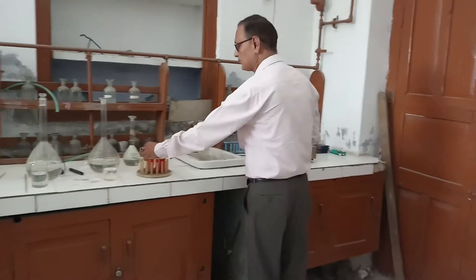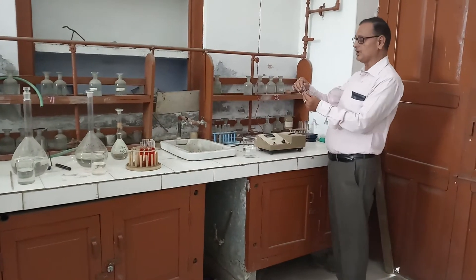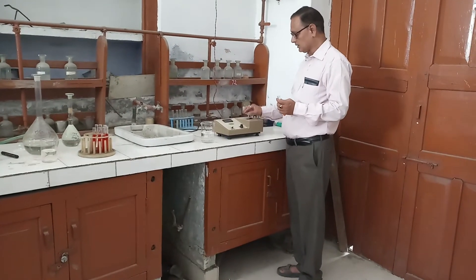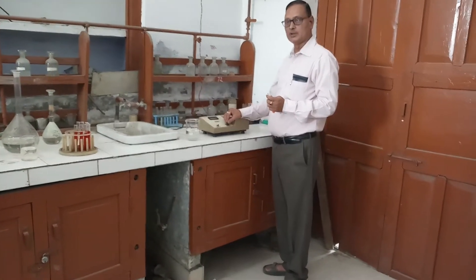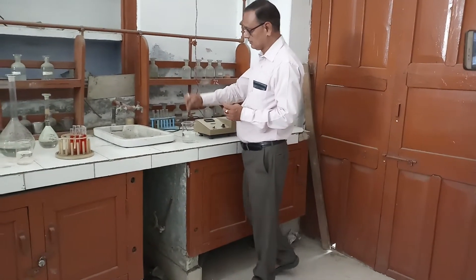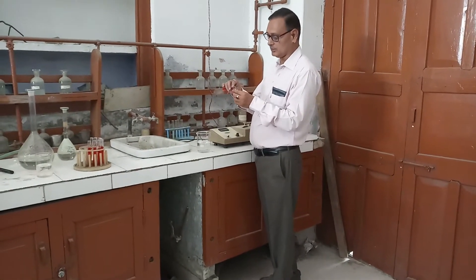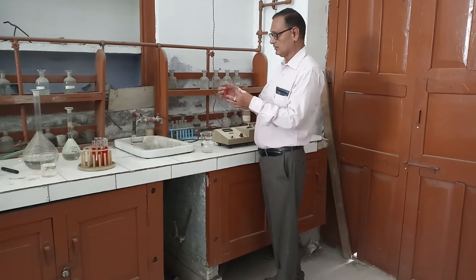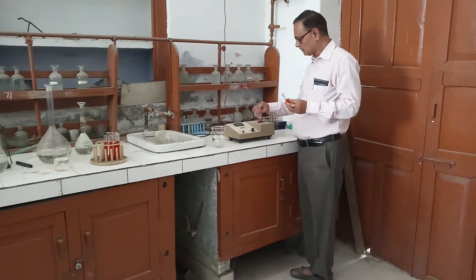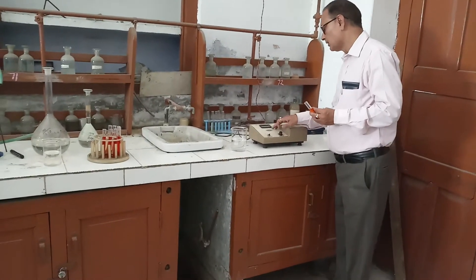For the first solution, you first keep the cuvette — insert the cuvette filled with distilled water and put it into the colorimeter and standardize with this distilled water. Then remove this cuvette and add the first solution, having 1 mL of iron and 9 mL of 1,10-phenanthroline complex. Put the cuvette into the sample holder and then read the absorbance.